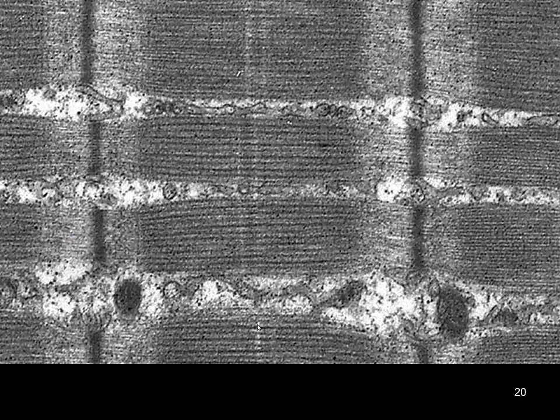Once again, even higher, getting a better look at the I, and I don't like these quite as much, but again, we can begin to look in here and we can see some of our T-tubules, sarcoplasmic reticula. There's one of our triads, T-tubule in the middle, terminal cisternae on either side. There's another triad of 3 that we can see there. Sections through some mitochondria, other cut sections through sarcoplasmic reticulum. So banding patterns are not nearly as interesting as what we're looking at in these high mags, as some of these other cellular components.